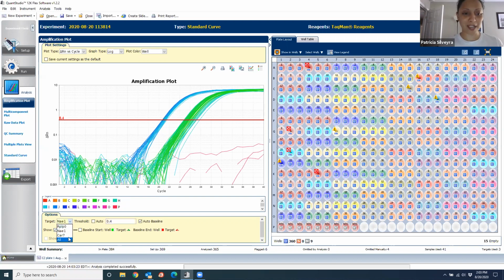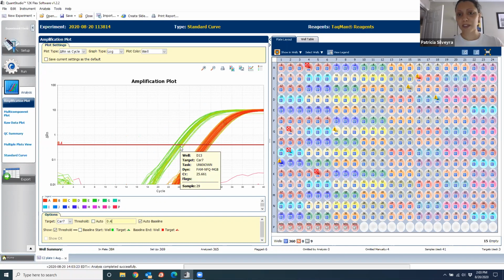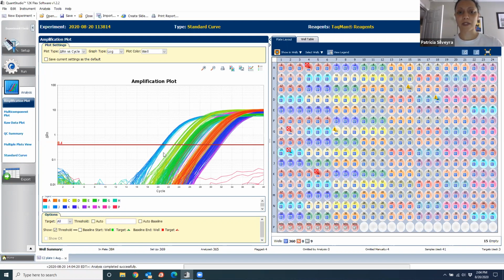Otherwise, you can just go blindly and put 0.4 for all of them and see that it's still kind of in the middle. And you can do 0.5 if you want. Again, you can always change it. But as long as it's the same number for the same gene, for the same experiment, it's good. If you keep changing it up and down, then you're not going to be able to compare one sample against another. So now that I normalize the threshold, I analyze one more time, and now everything looks a little bit more consistent, right? So now I am able to compare at which cycle each of the samples met the threshold.